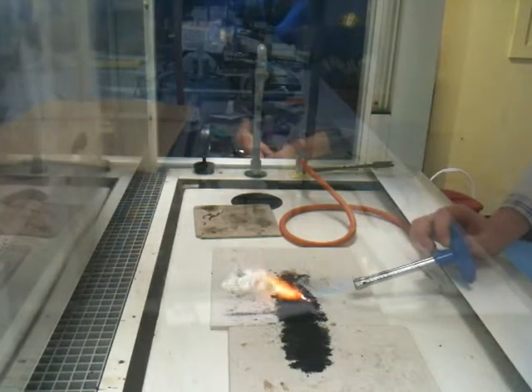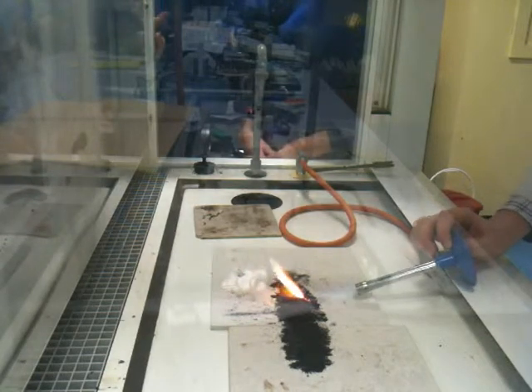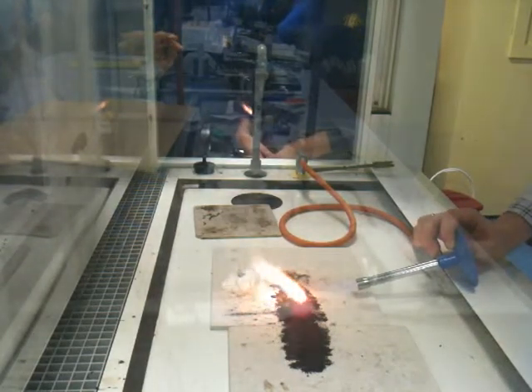Guys, unfortunately this isn't working as well as I'd hoped, but what you can see is, oh, that's better.